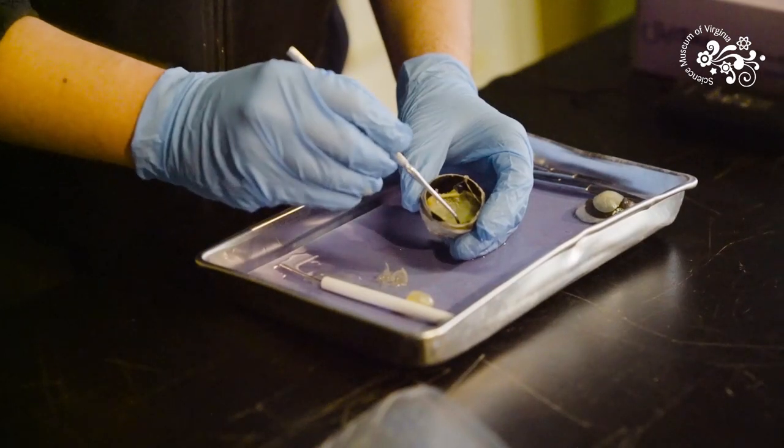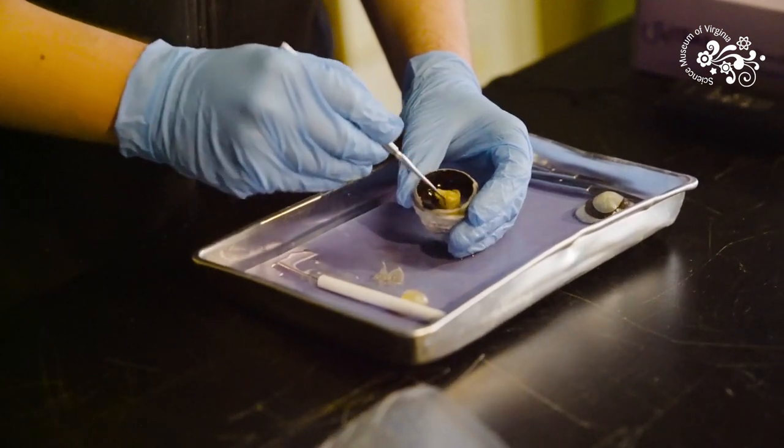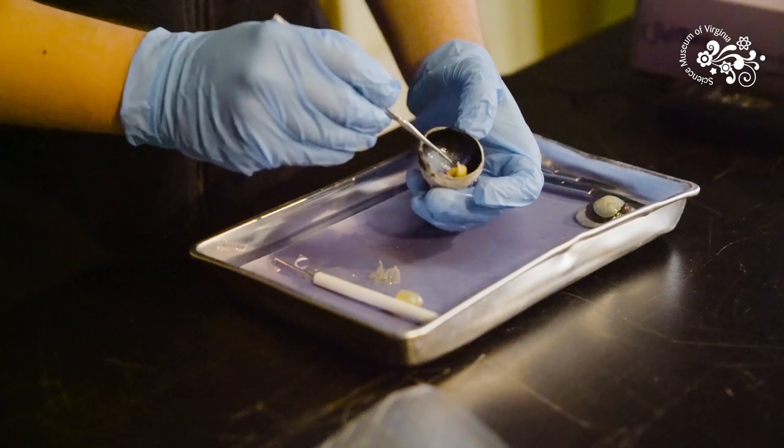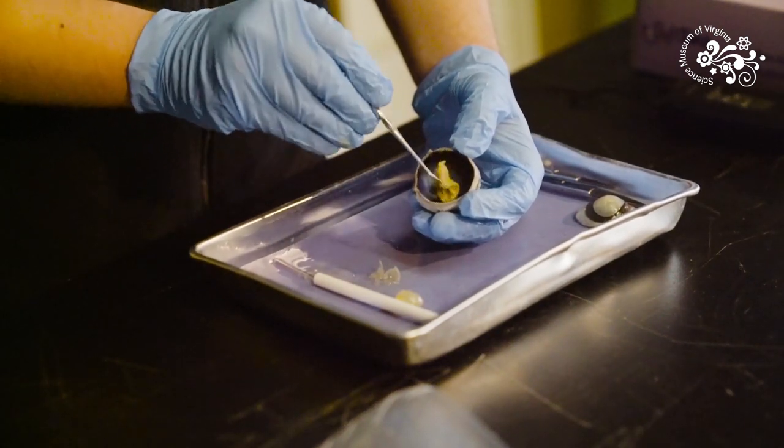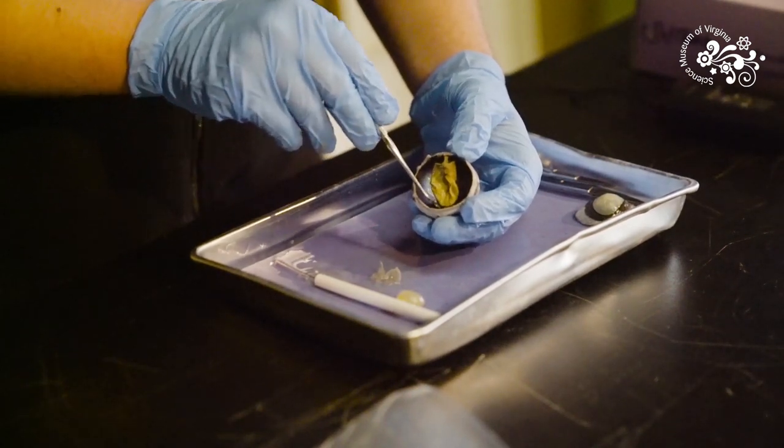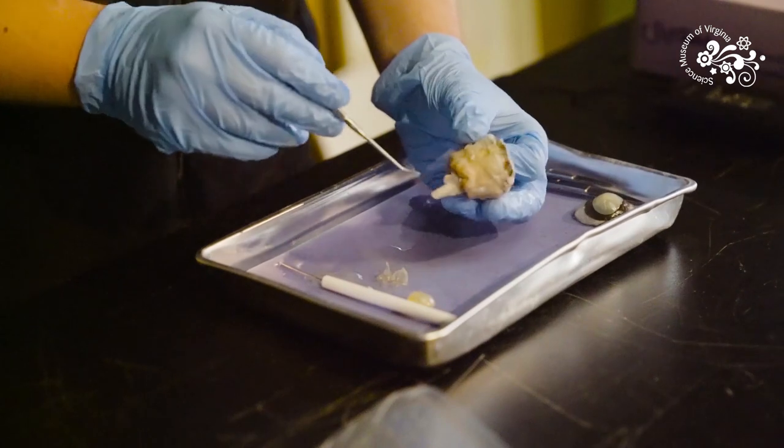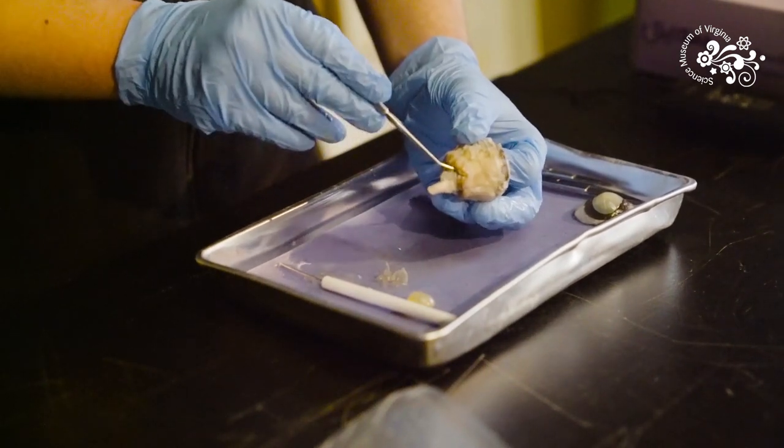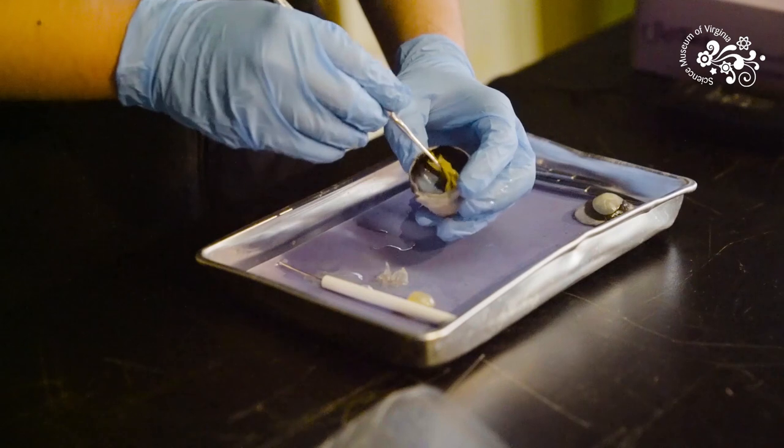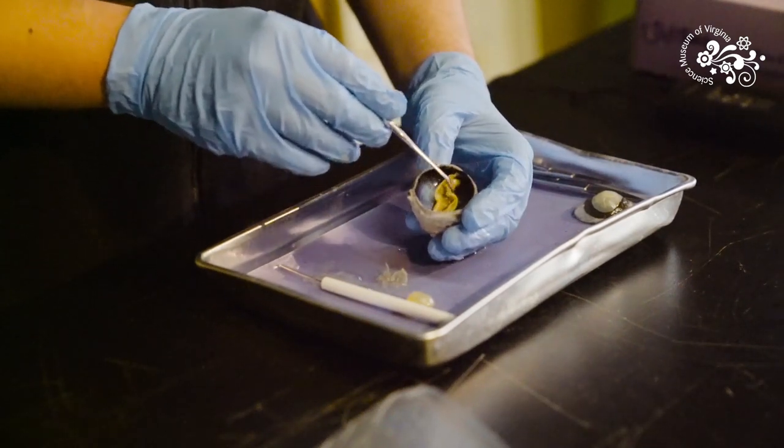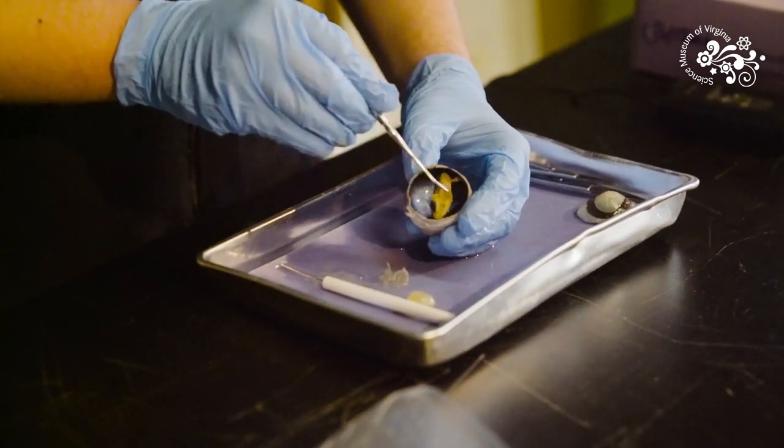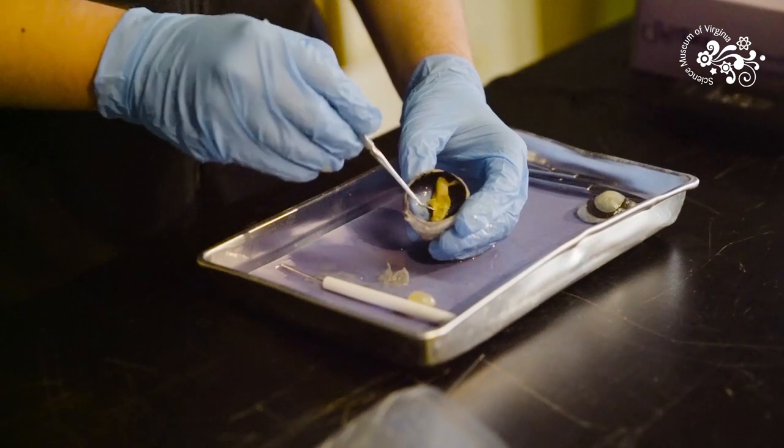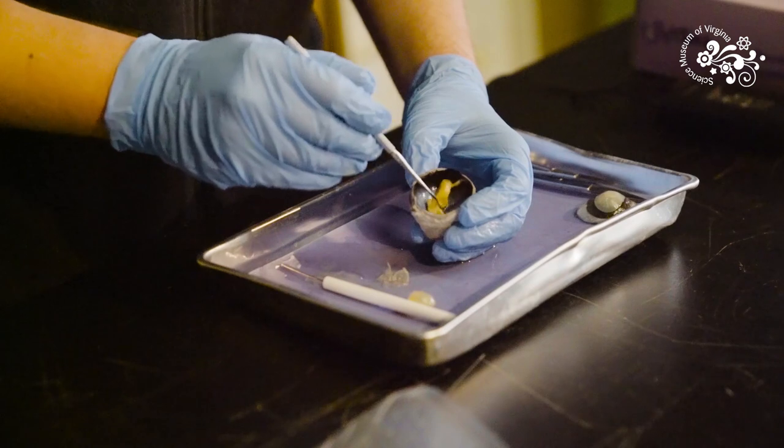If we go ahead and scrape all of this retinal tissue up, we can find the point that it attaches back here. There's just one little point in the back of the eye where it's not removing quite as easily. That's called your blind spot or your optic disc. That's where the optic nerve pokes into the back of the eye to collect all the information that your rod and cone cells are making and deliver it back to the brain. But because you have optic nerve poking through right here there's no room for rod or cone cells, so any light that shines on this point in the eye is completely lost. That's why you have your blind spot.